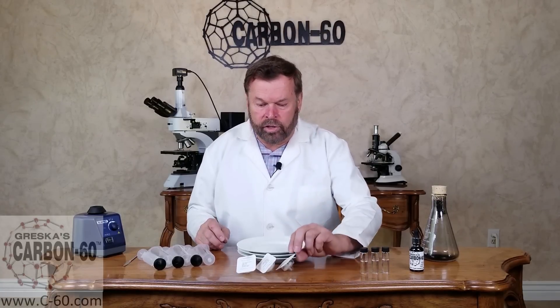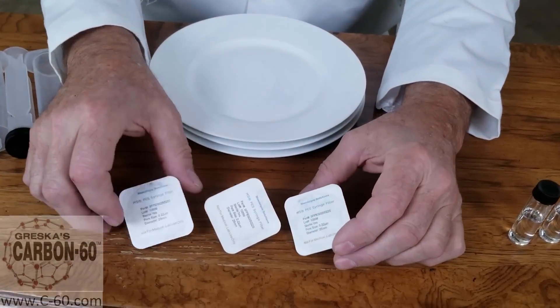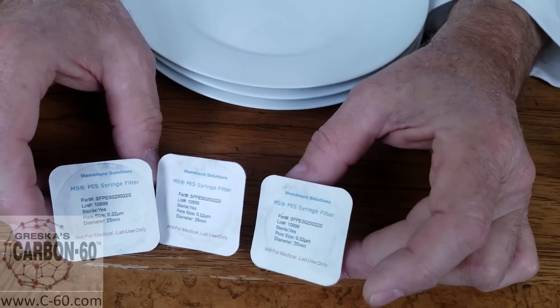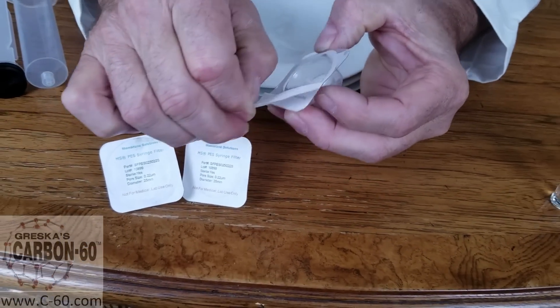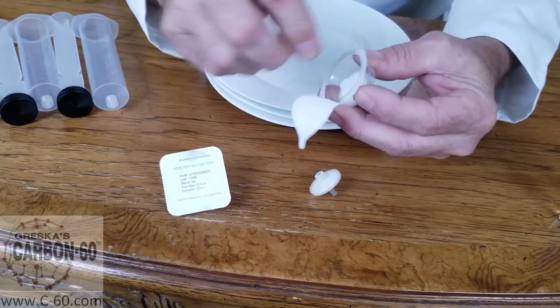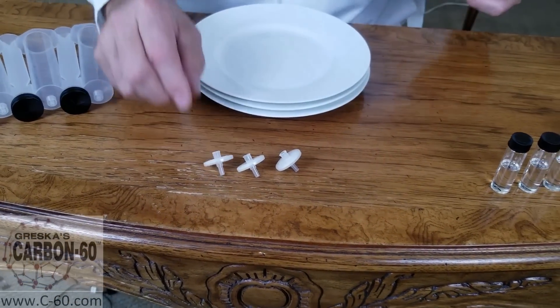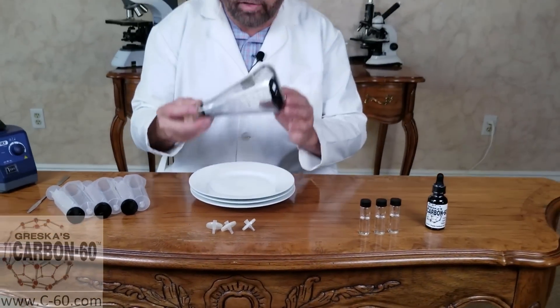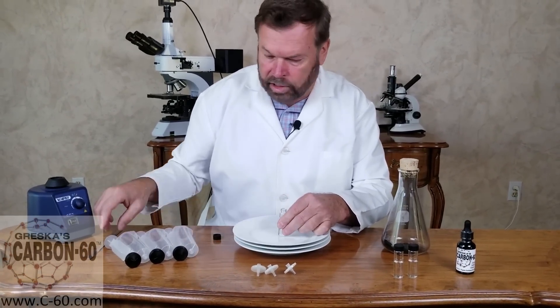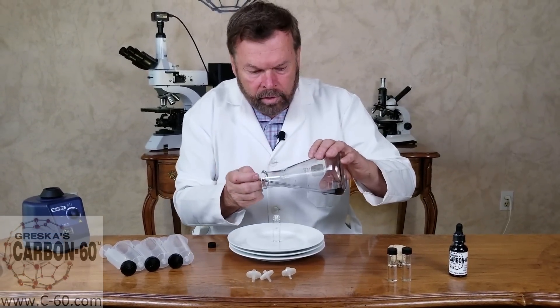Okay, here we're going to demonstrate it and we're going to show you the filters. These are the filters we're going to be using and they're all the same. They're all 0.22 micron filters — let me get this one so you can read it. They're all identical. We're going to open these up right now and show you that they are all brand new, all coming out of the package. They're all 0.22 micron filters — the size of the filter is going to be the same. Now we're going to take a little bit of our carbon 60, put it into all three of the solvents — they're all coming out of the same jar.